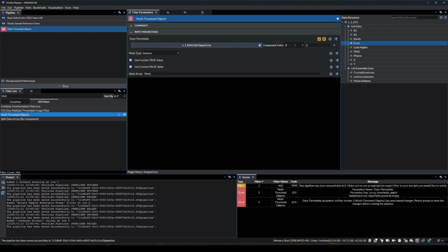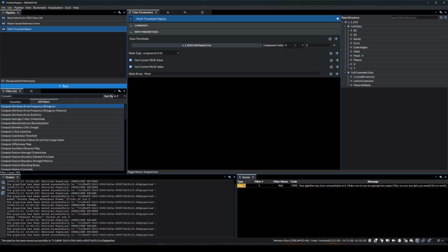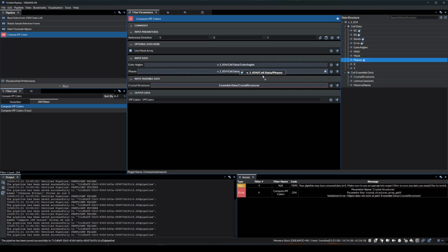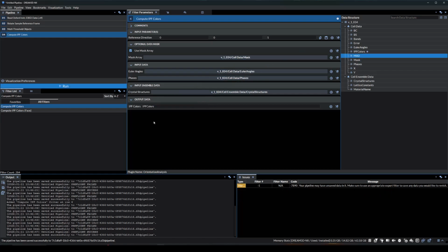Next, we'll need a multi-threshold objects filter. Apply the error object to the path parameter, then filter out anything equal to 0, then change the mask type to unsigned 8-bit integer. Now we'll need a compute IPF colors filter. For this filter, all we need to do is populate the required paths. Ensure you enable Use Mask Array and use the mask object for this path.